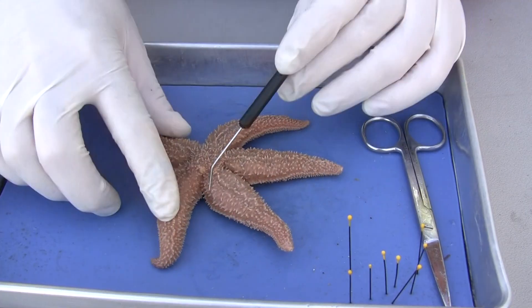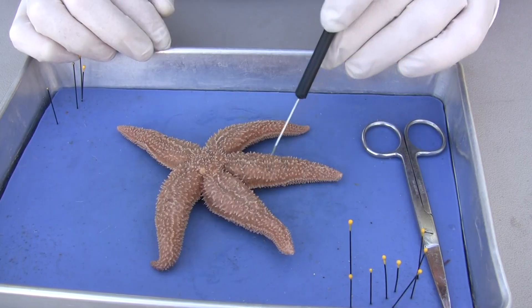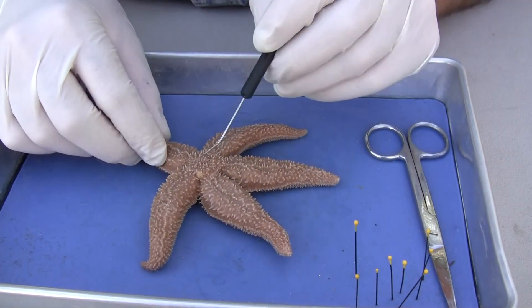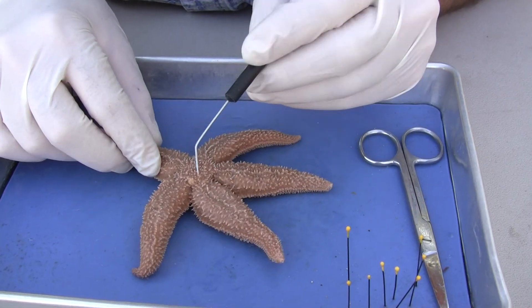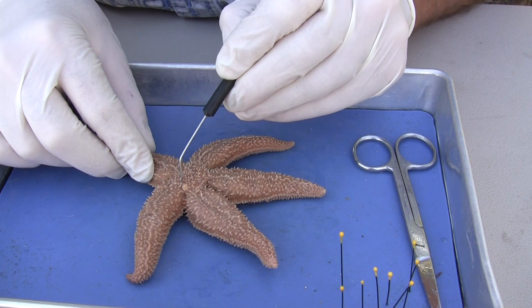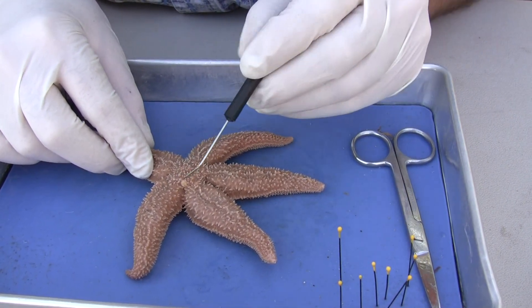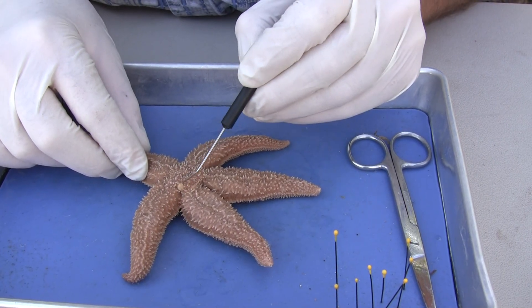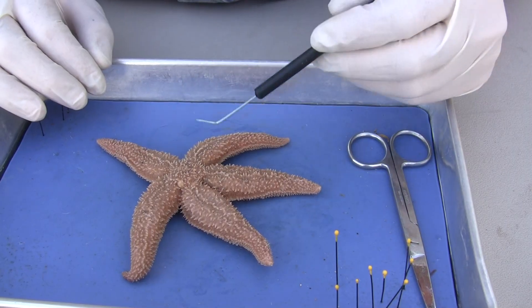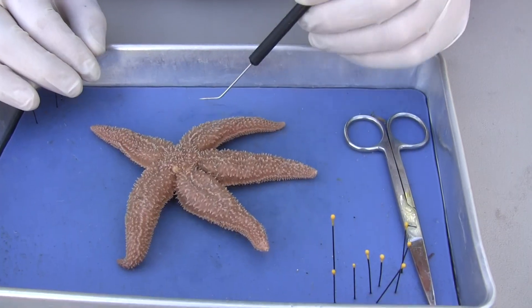And the top part, this is the aboral surface. And each of these individually are called rays. The interesting thing on this surface, the aboral surface, is the madriporite — the madriporite or sieve plate. And this is where water moves into the water vascular system of the starfish. So since this is radially symmetrical, we could dissect any one of these rays or arms and we're going to see the same thing.